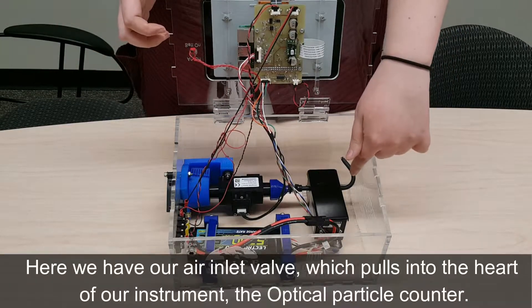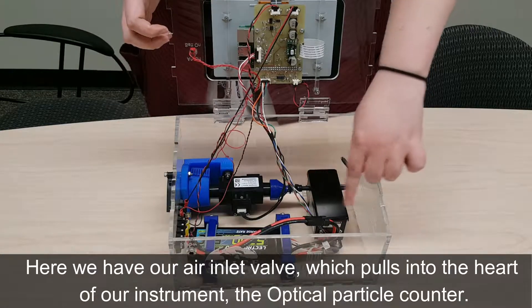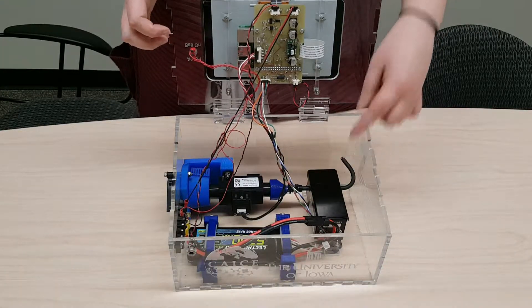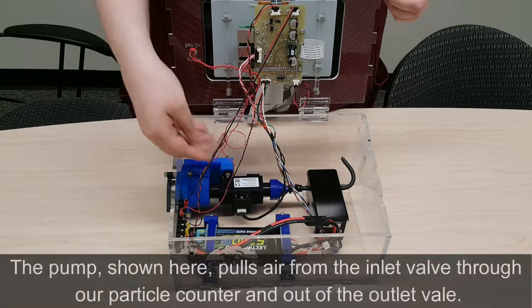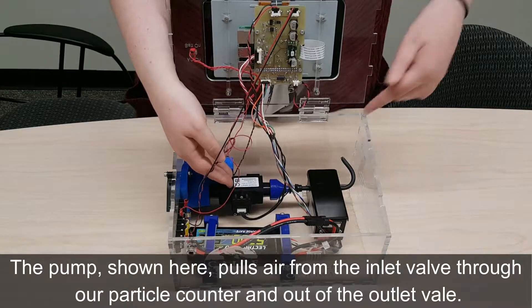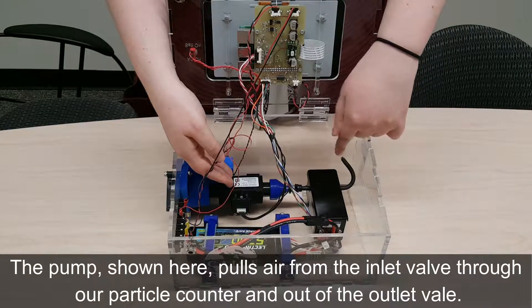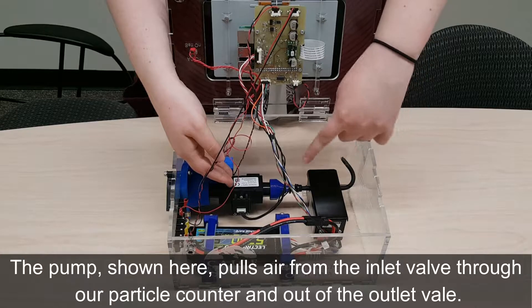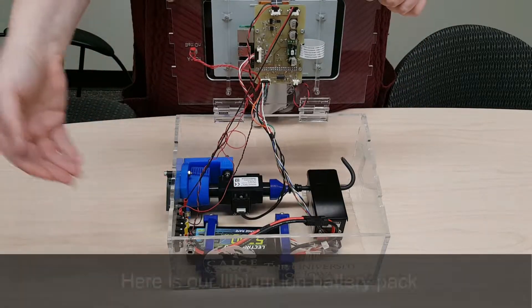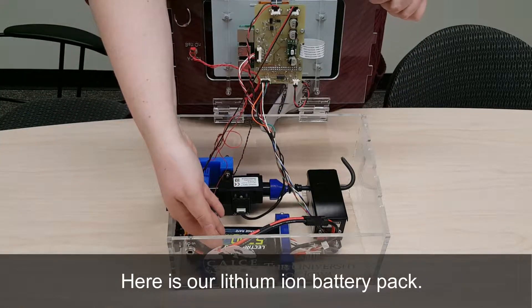Here we have our inlet valve, which pulls into the heart of our instrument, the optical particle counter. The pump, shown here, pulls air from the inlet valve through our particle counter, and then out of the outlet valve. Here is our lithium ion battery pack.